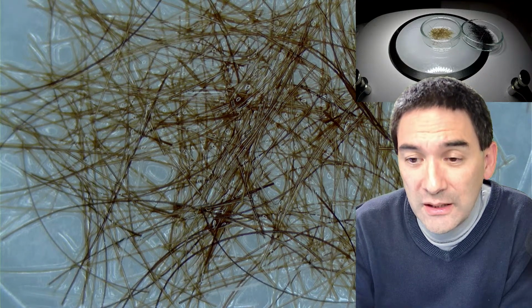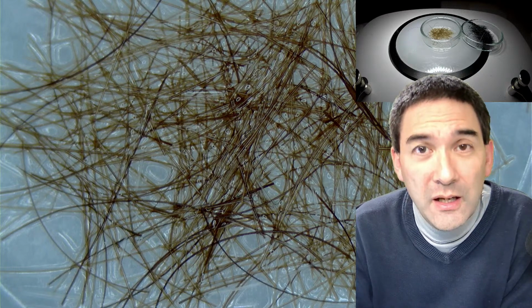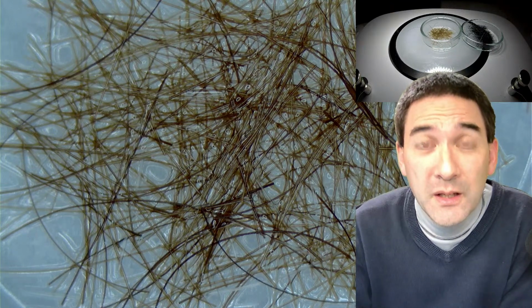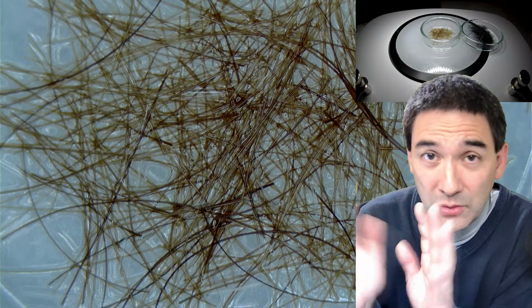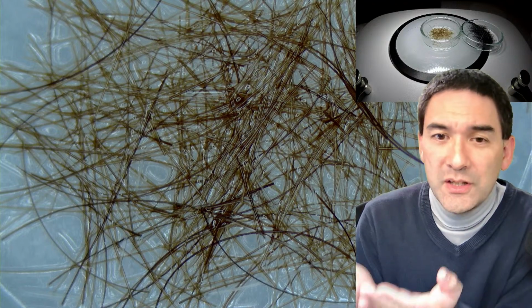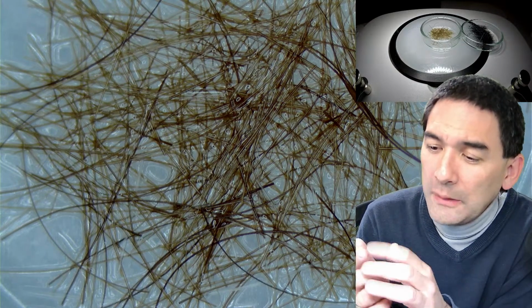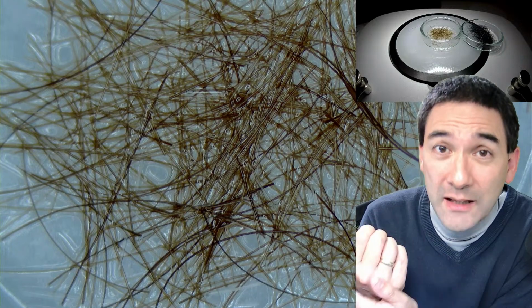Hydrogen peroxide is H2O2. I used 30% hydrogen peroxide, and you do not want to mess around with it. I have to give you a warning. This stuff is very aggressive at 30%. 3% hydrogen peroxide can be found in disinfectants, hand disinfectants, not a big issue. You still don't want to get it into your eyes. But I got some 30% hydrogen peroxide today on my finger, and it kind of burned my finger. At least it didn't burn it. The top layer of the skin actually turned completely white because it's highly reactive to hydrogen peroxide.